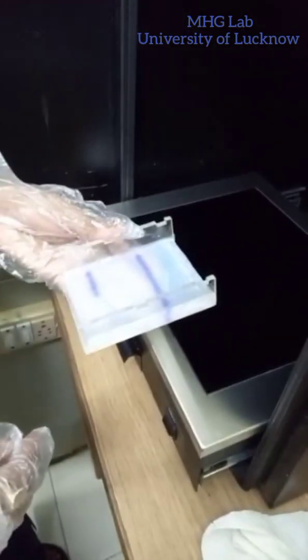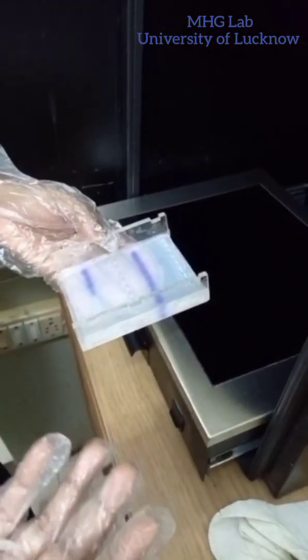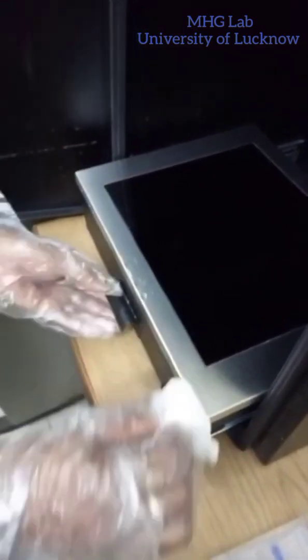We put it in again in the tray if we have to run it for some more time. This is how we remove it so the gel does not get damaged. We will put it aside and now we have to clean the surface.